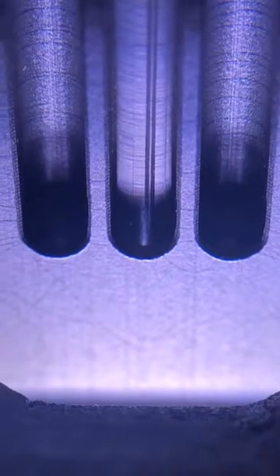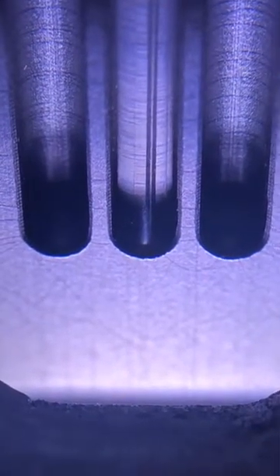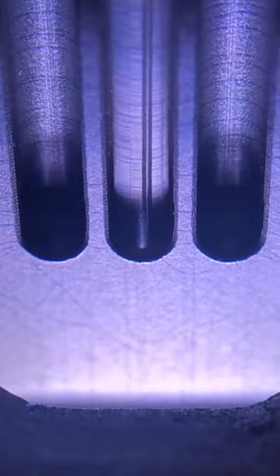So we'll go back to this. I'm going to start the temperature ramp. And I'll fill you in on to what's going on here as it goes along. Right now we're at 105. You can see the open tube in the middle. That's the capillary. You can't see the glass very well, but you can see it if you focus. There's two lines going next to that open tube or that open section. Depending on the liquid that's in there, it's harder or easier to look at.